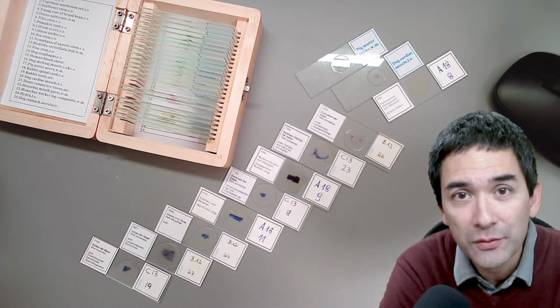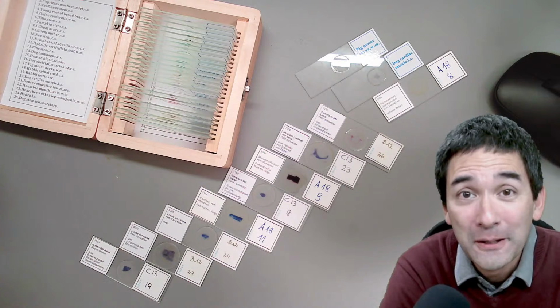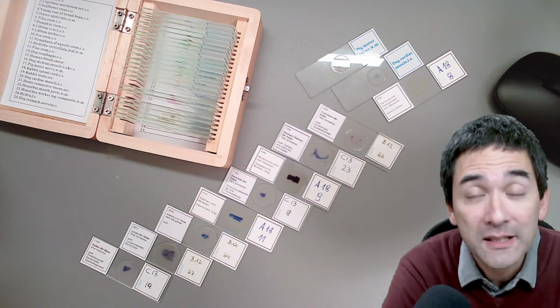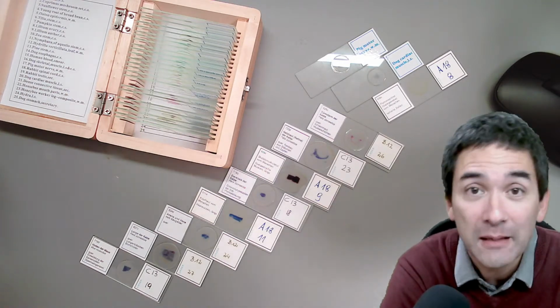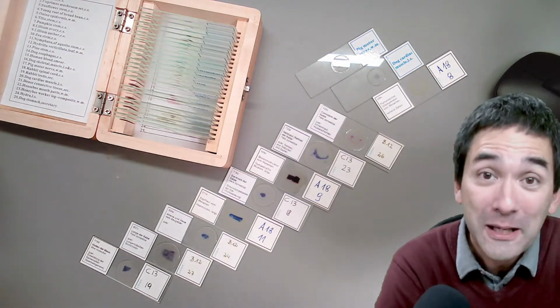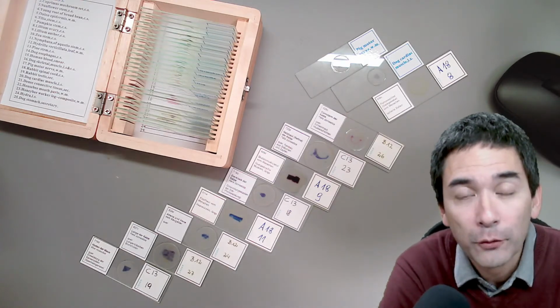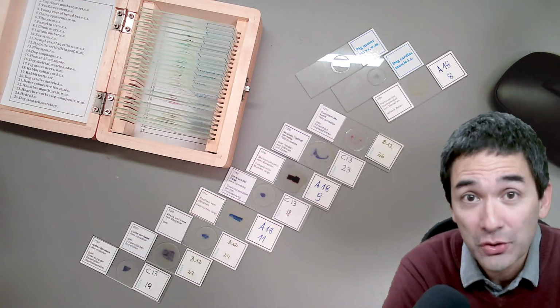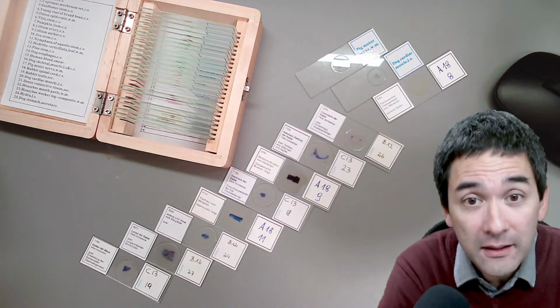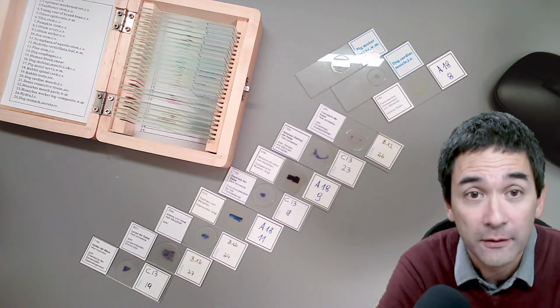I just recently received a comment beneath one of my YouTube videos where somebody said that they like the channel very much and it's all very interesting, but it's a little bit repetitive because I'm always putting the same specimens under the microscope, like of course plants and water samples, and I agree. It is becoming a little bit repetitive for myself too, and there has been the request to also put some animal tissues, also human tissues, under the microscope. Because I do not make permanent slides of human tissues myself, I just want to show you some commercial slides that I've got here.